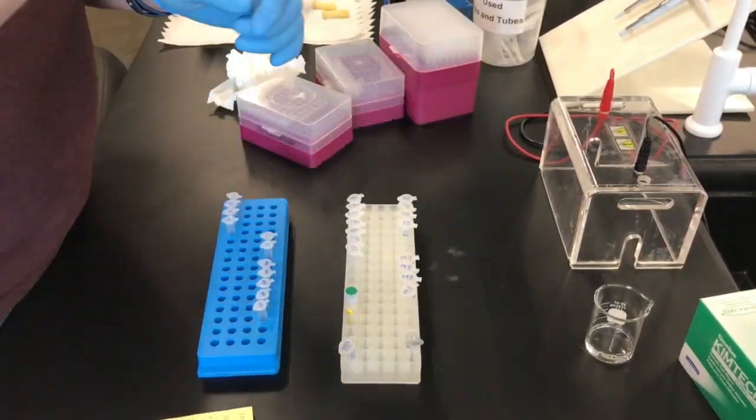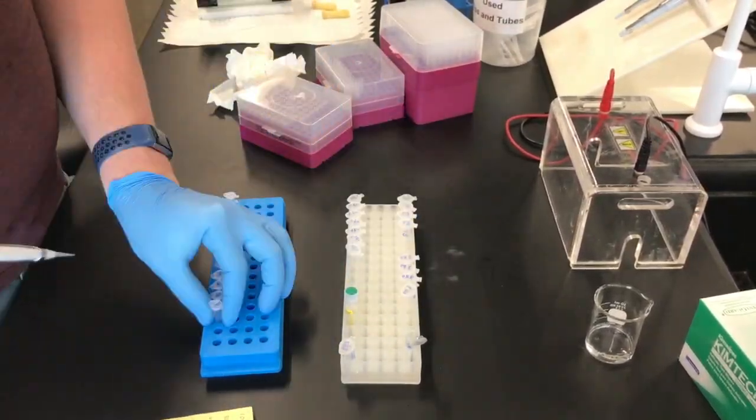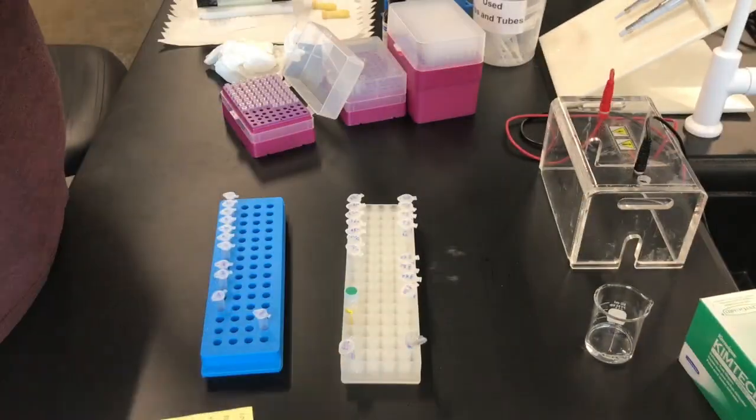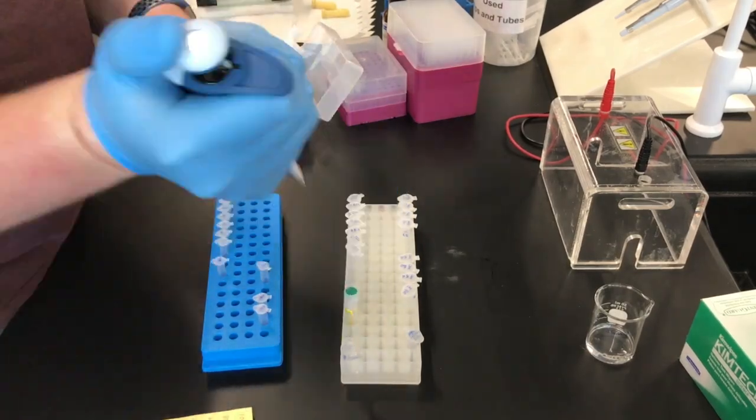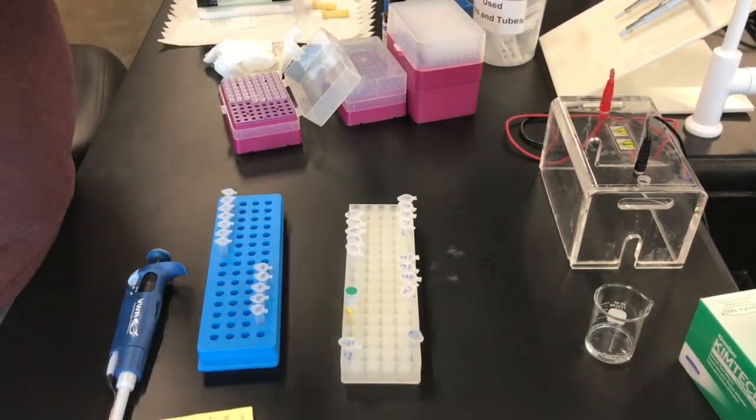While the stacking gel is solidifying, you can prepare your samples by mixing together 2.5 microliters of 4X loading buffer and 7.5 microliters of your sample.